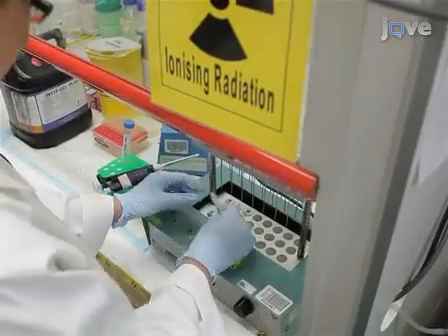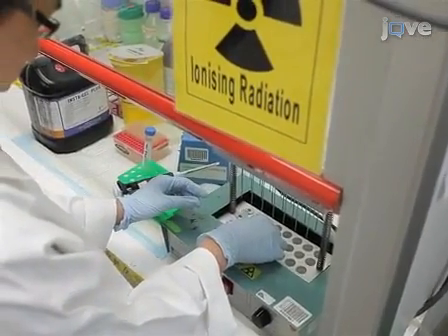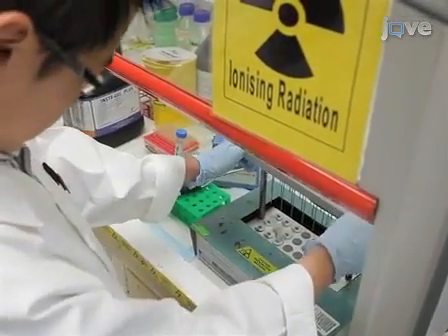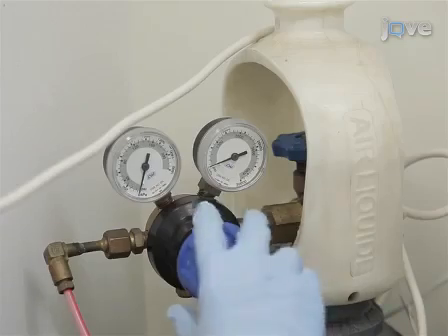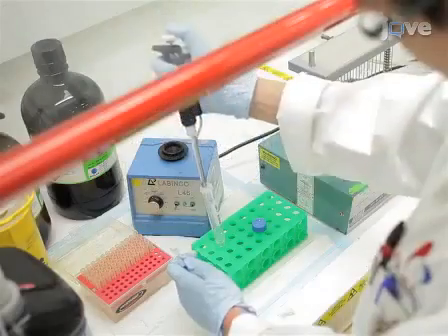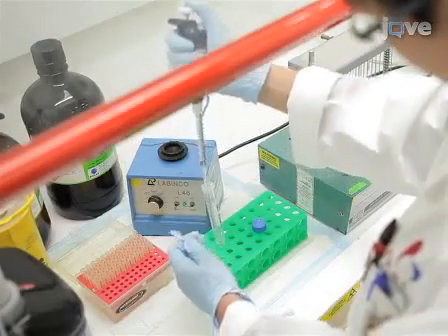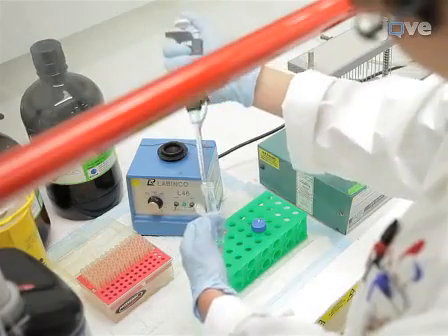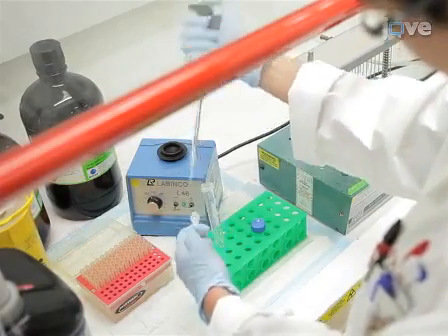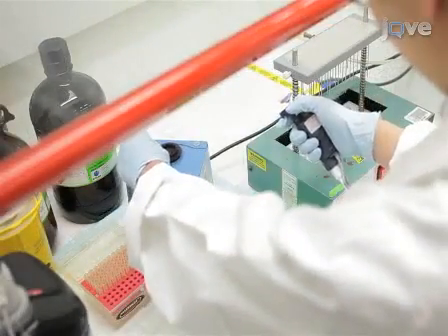If the stock of tritiated cholesterol is supplied in toluene, dry it down completely with nitrogen gas. Re-dissolve to a working stock of one millicurie per milliliter in 100% ethanol and vortex to mix well.